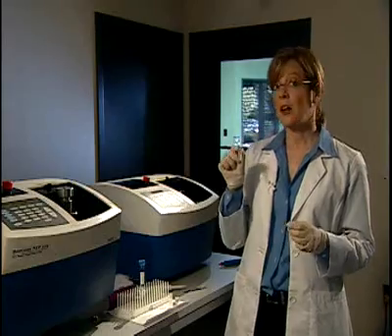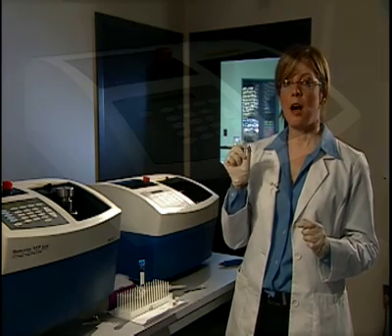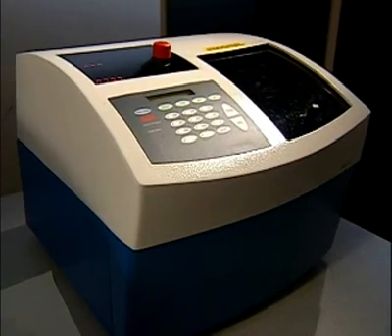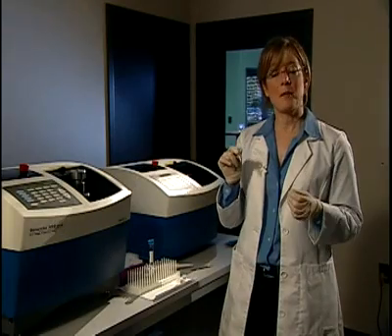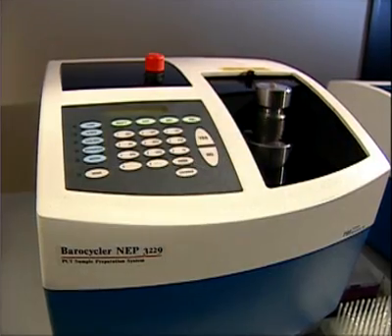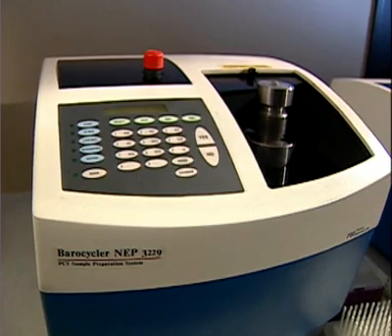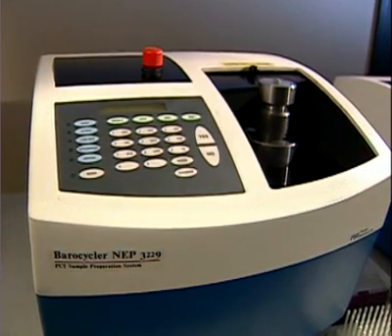Since I only have one sample to prepare, I'll be using the barocycler NEP-2320. However, on days when I'm processing multiple samples, I would use the NEP-3229, which can process up to three samples at a time.